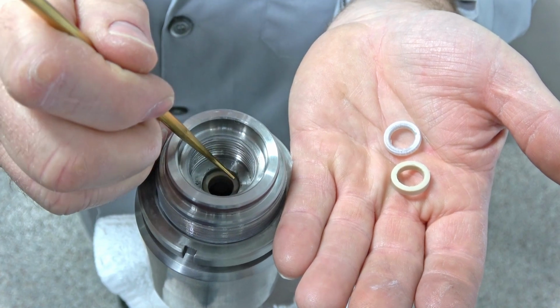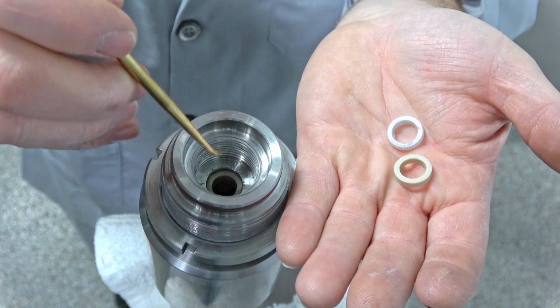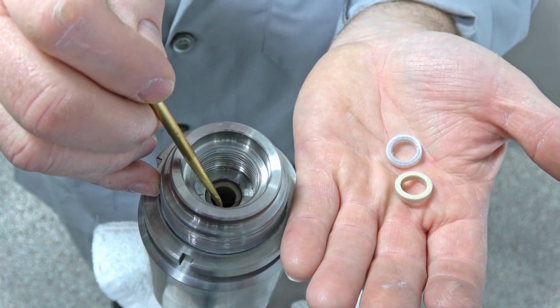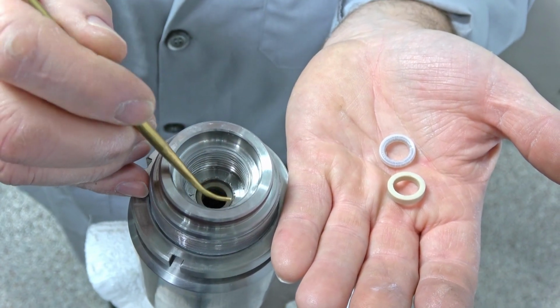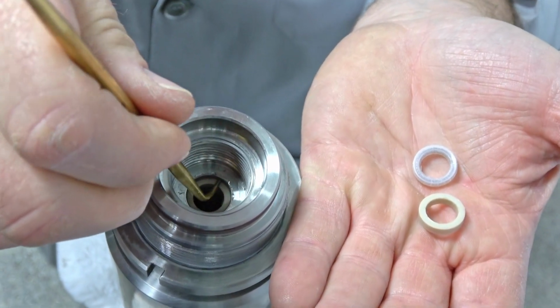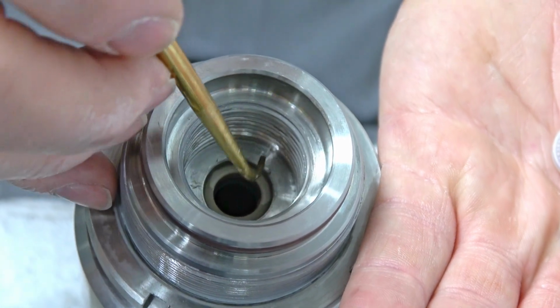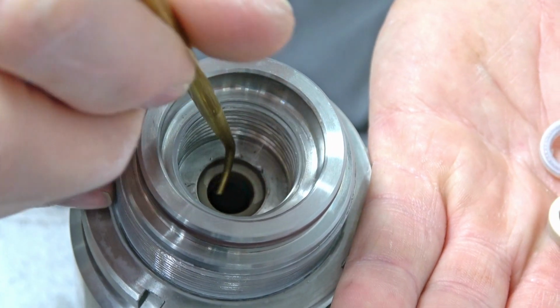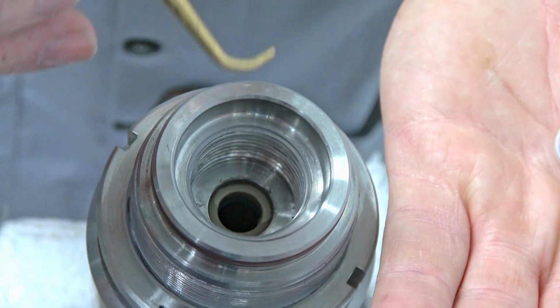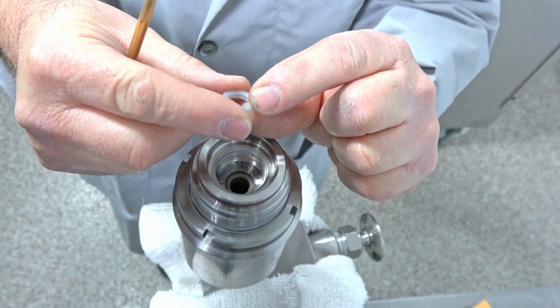So anyways, I'm not going to take this out here, but right here, like I said, you would just push that under there and just work that out. Get that one out and do the exact same on the next one. It's not that hard.